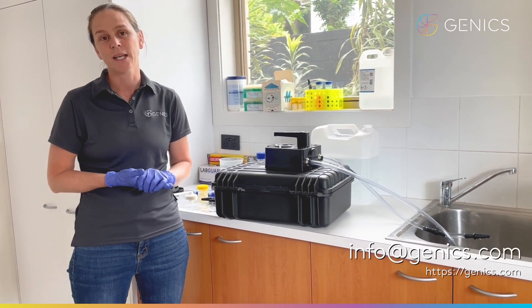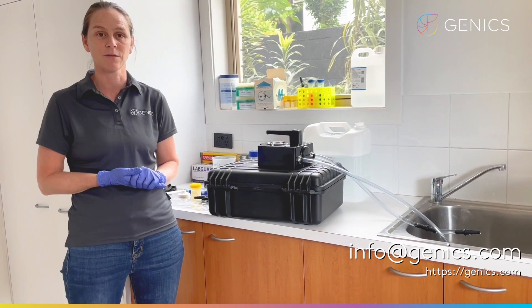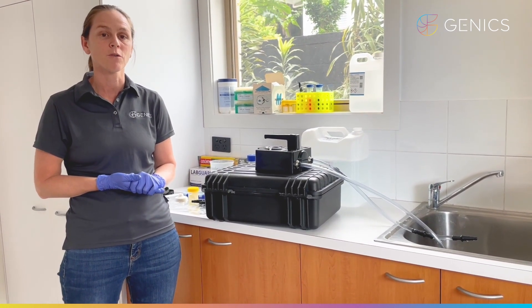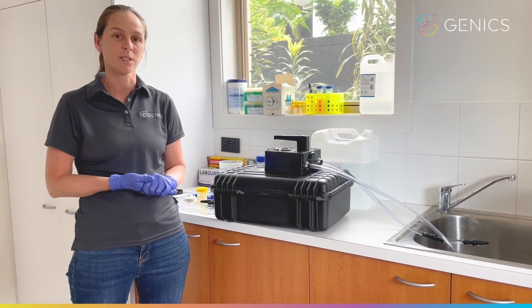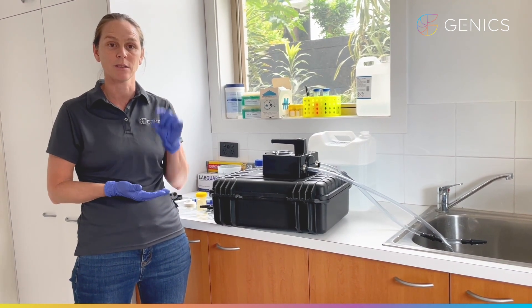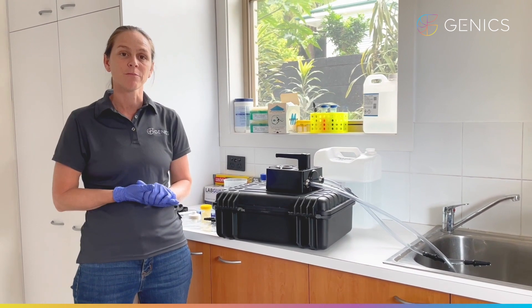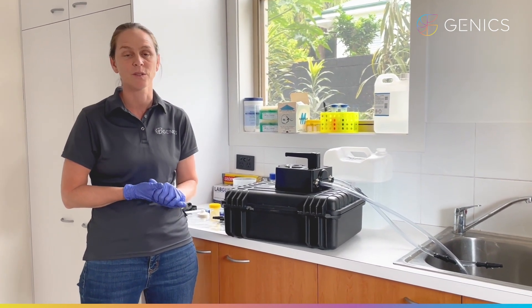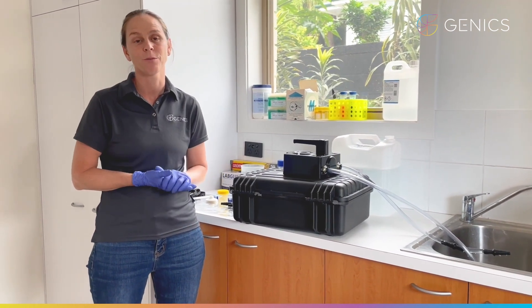You're more than welcome to contact us anytime to help with your statistically significant sample plan. Typically we would take four replicates of one litre per sample site on the NCE filters and pool those NCE filters per site into one pot, one multipath test. But the number of positions from which you take the samples will vary depending on whether you're sampling intake water, the pond, or the drinking water from your farm.